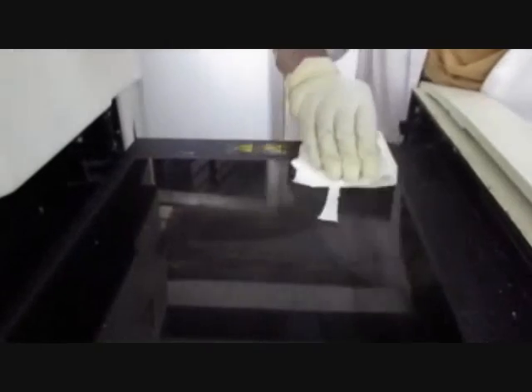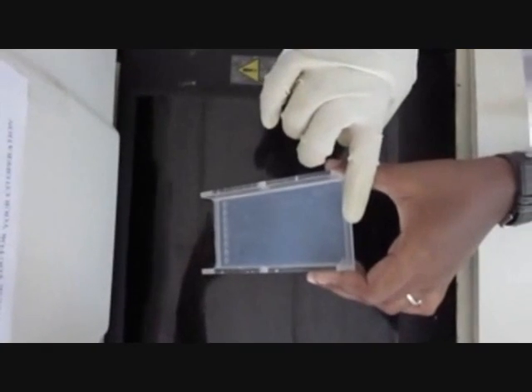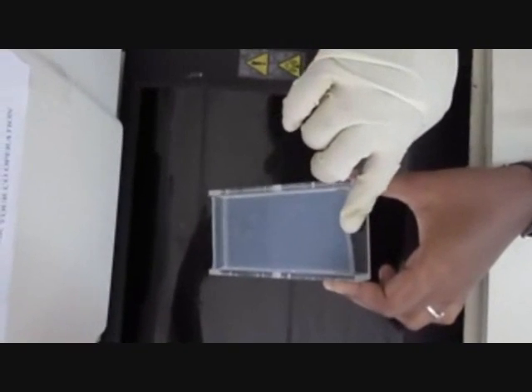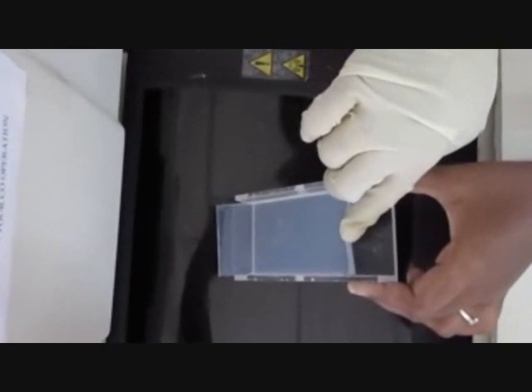Procedure: Before placing the gel on the stage, the stage is wiped clean by the use of ethanol. The gel is then slowly placed on the stage by sliding the gel with gentle pressure from the template. Care must be taken to prevent the breaking of gel as gels are very fragile.